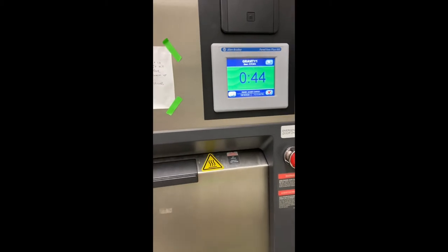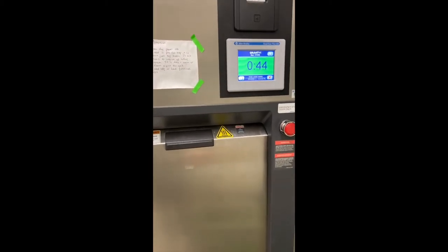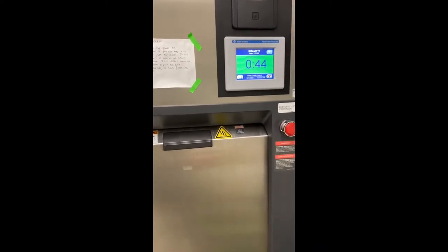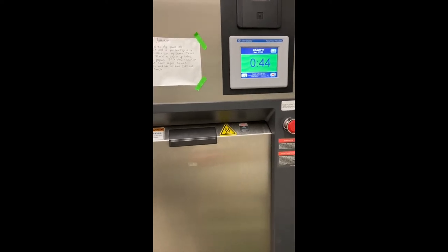The reason we put them in the bag in the autoclave is not because they're biohazardous — it's to protect them from anything in the autoclave that might get on them, because the eggs and larvae can be really sensitive to what's on the trays, like soap or other debris. We just want to make sure they're not going to be affected.